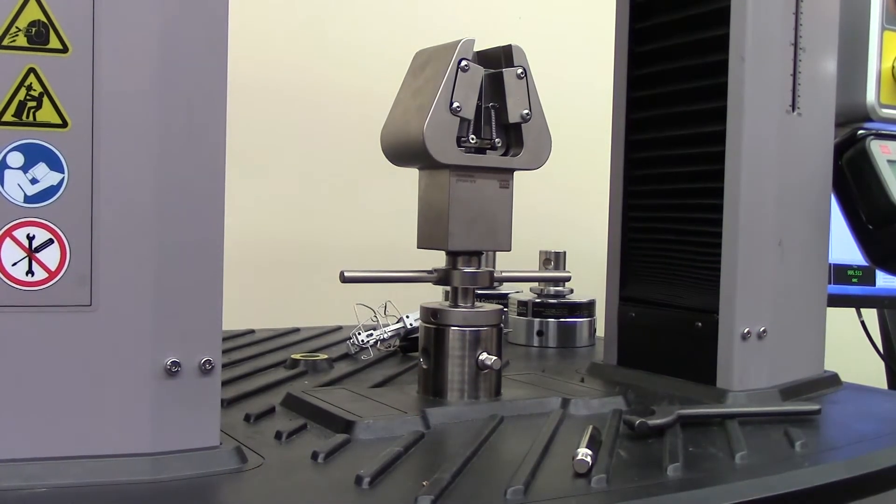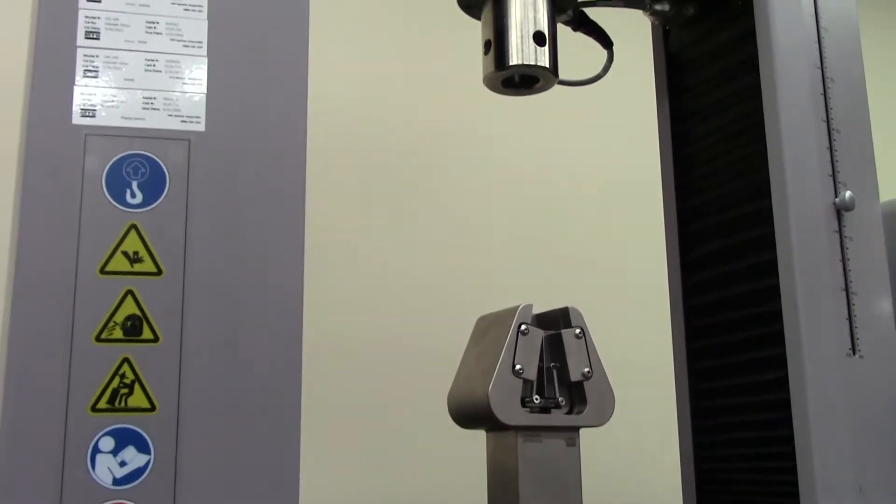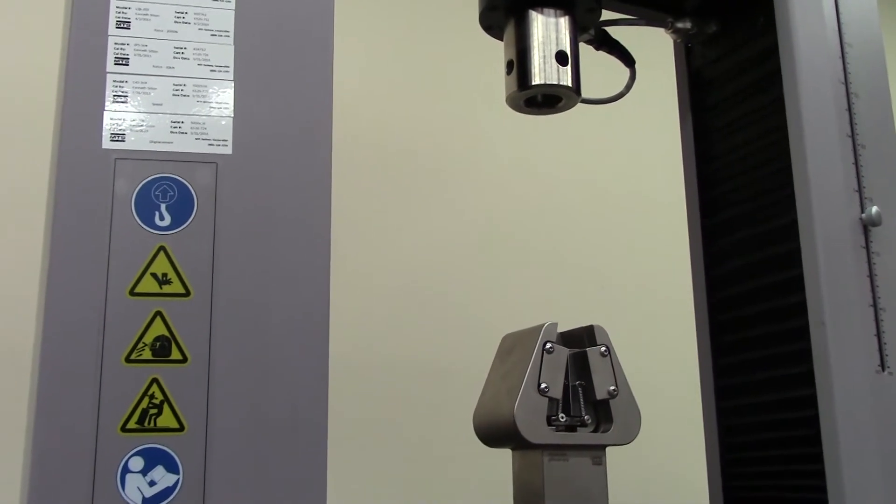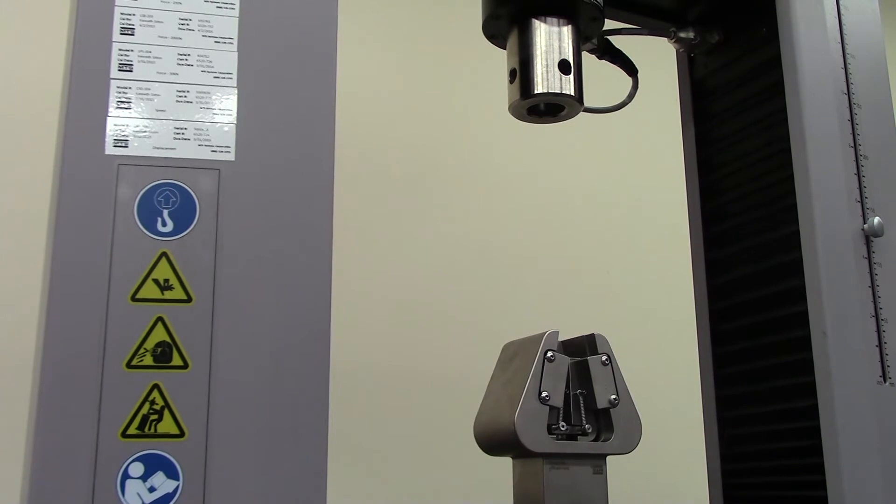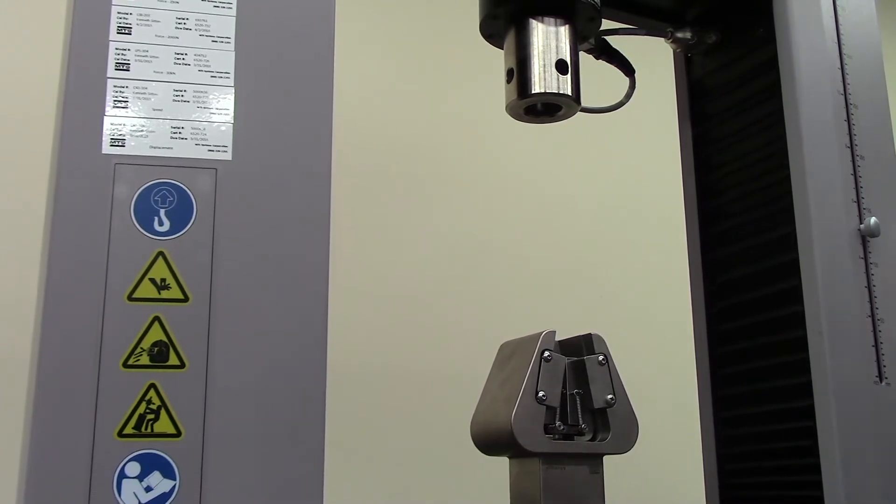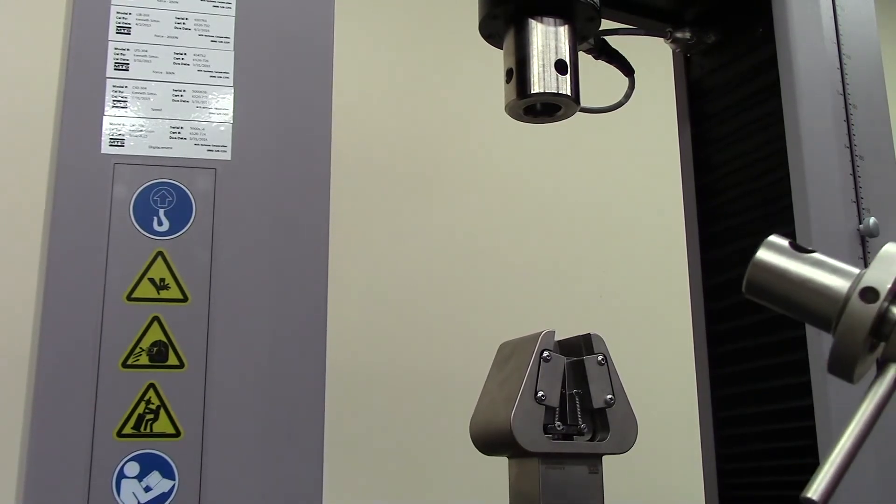Similar procedure for the top grip. We'll move this up just a little bit.